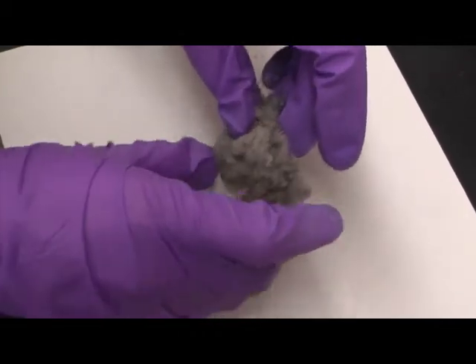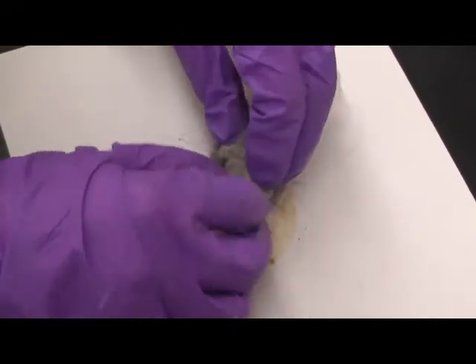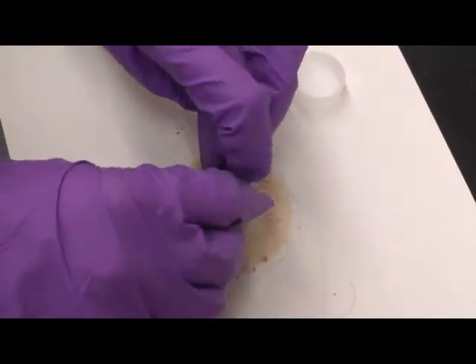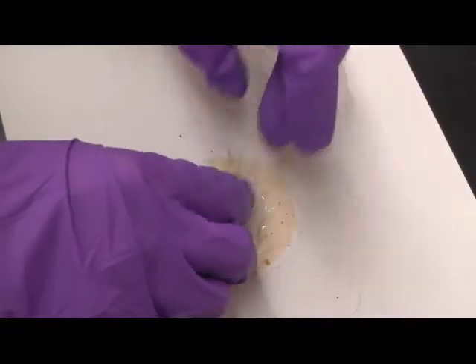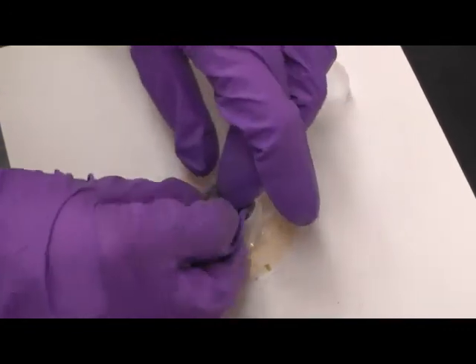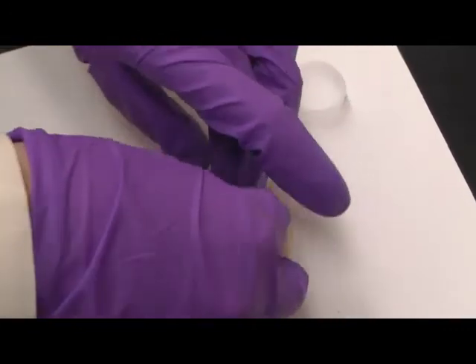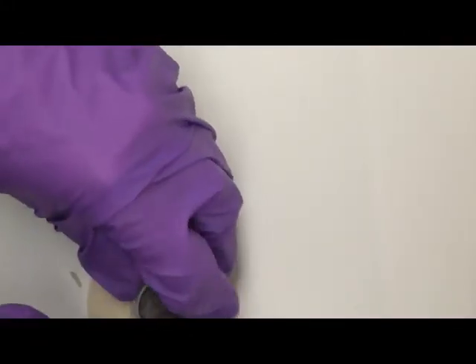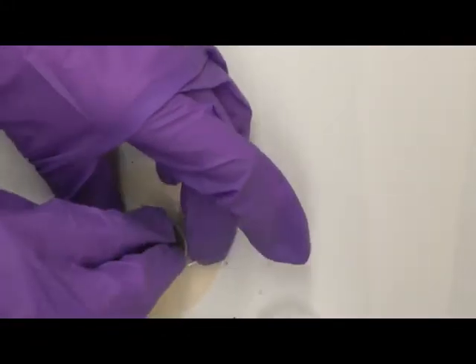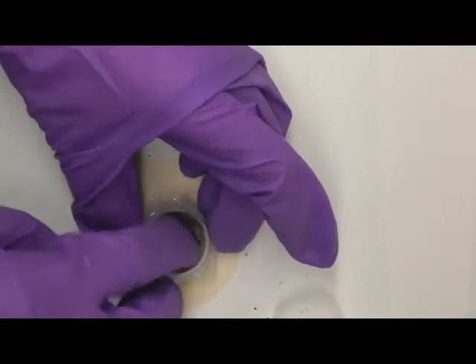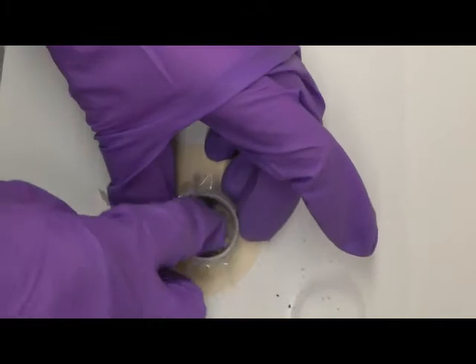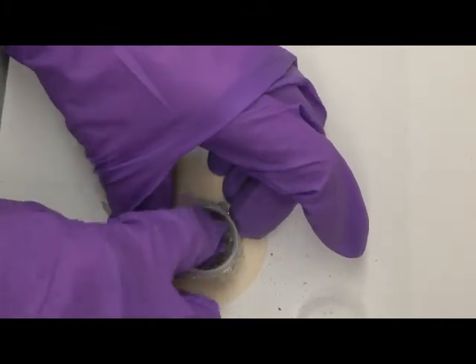And really make sure that it's pressing it down and make sure it's packed really tightly. I cannot see my half height marks, so this much of dust should be enough.